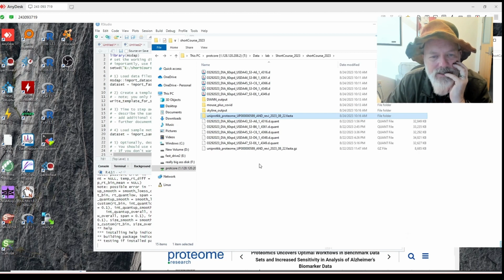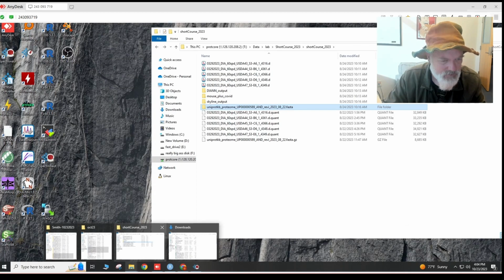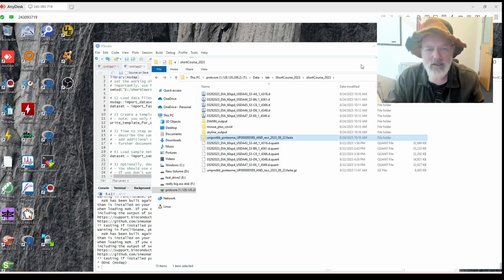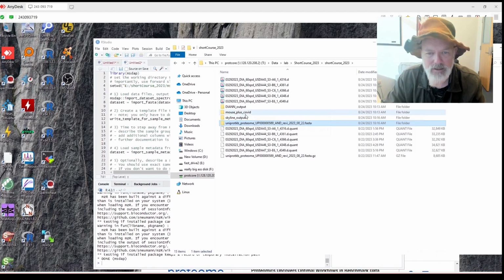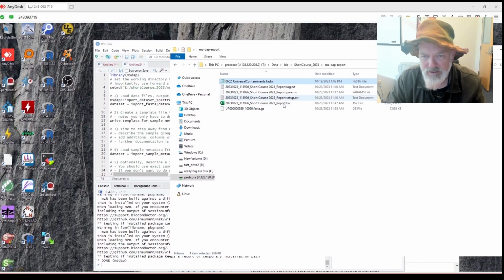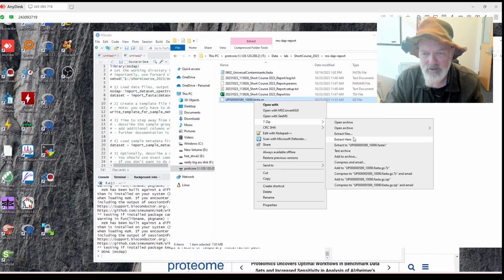Okay, so I use two FASTAs, which I will copy onto here in a minute. Let's see. So I put them also on here. So I kind of have to do a little data wrangling. Okay, so I use this one and this one. So I will copy that to the network drive. Short course 2023, MS DAP, paste. Okay. All right, let's go back. MS DAP report. All right. Let's see. Short course 2023, MS DAP report. We'll get the FASTA files here. And why is there only one? Oh, here, because that's the copy of this gzip file. Okay, so we're going to extract here.